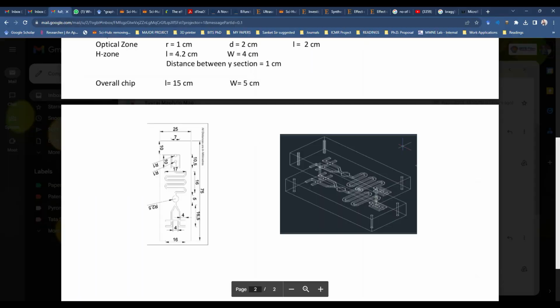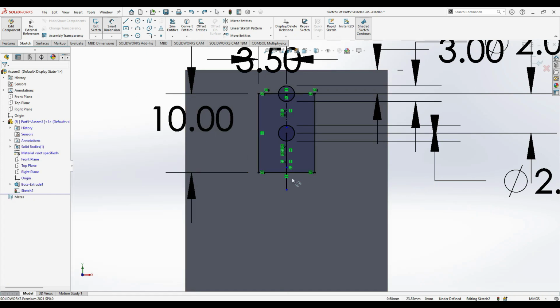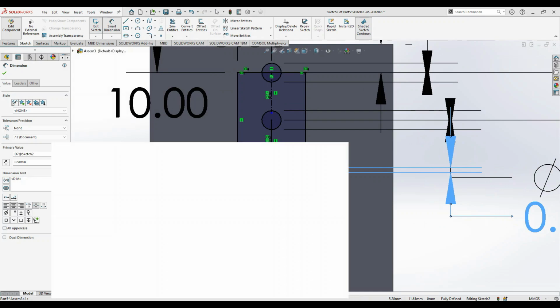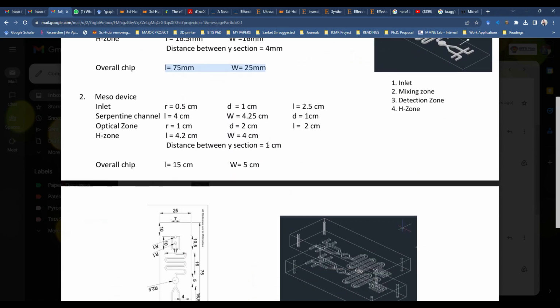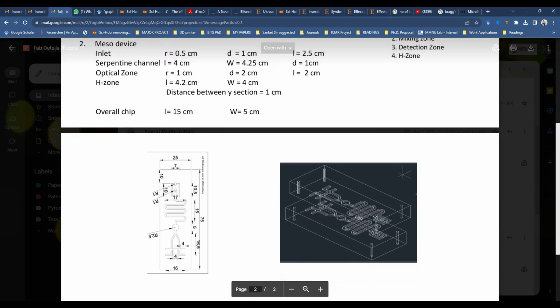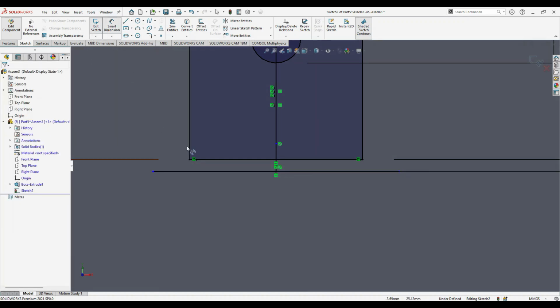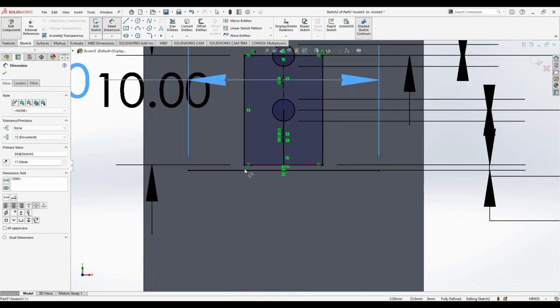So then we'll go for the serpentine design. It is having a 0.5 mm of this length. So we can give it 0.5 mm. According to this, the length of the serpentine channel is 16 and 17 mm. So to do 17 mm, you can just select the midline and create a first 17 mm line. Yes.